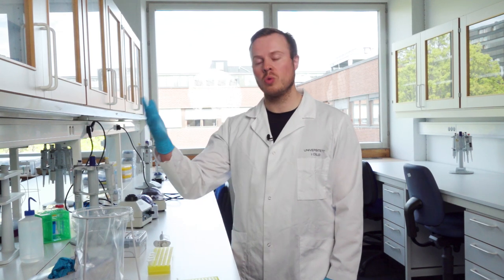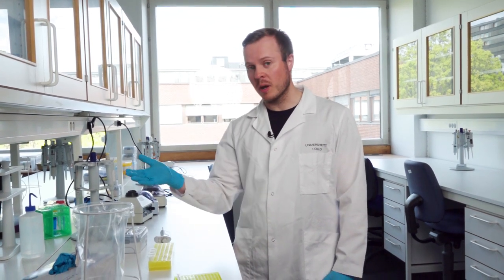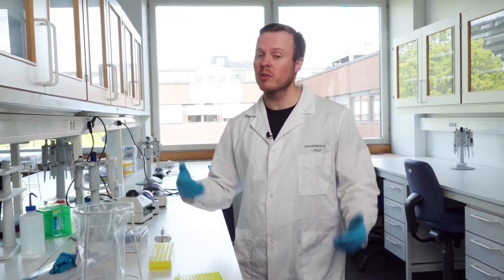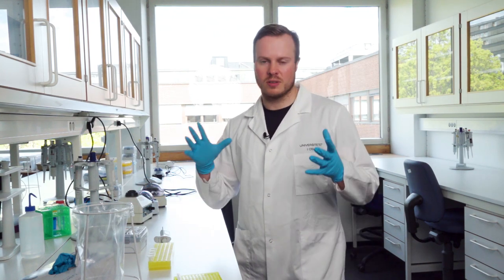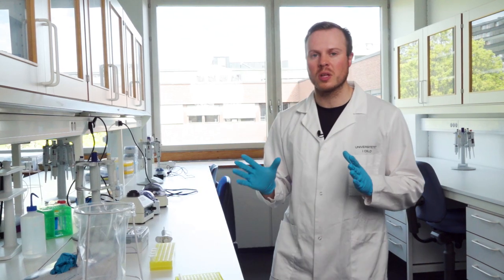We have moved from the pre-PCR lab to the post-PCR lab. Even though I look the same with the lab coat and gloves, this has been changed, which is extremely important because the coat that is in the pre-PCR is not allowed in the post-PCR, and the post-PCR gloves are not allowed in the pre-PCR. So it's a very important detail to keep in mind.